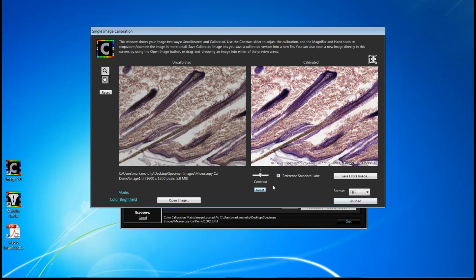We find that contrast is very much a personal user preference, and often image dependent. We also have what we call a reference standard label, and that's the text that's shown here on the bottom of the image, and you can either toggle to include it or not. What we generally find is CHROMACAL users want to represent to their colleagues or their customers that they used a higher degree of imaging integrity and a standard for their images. So they generally leave that text to be displayed. But again, as I said, you can remove it if you want.